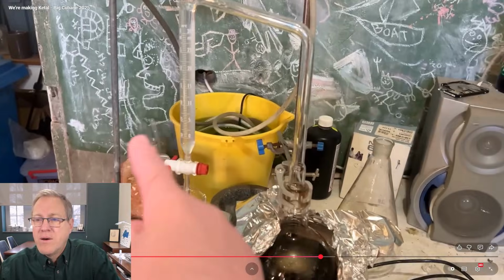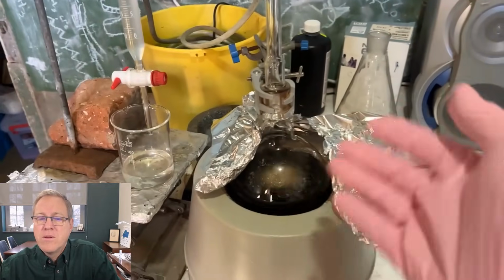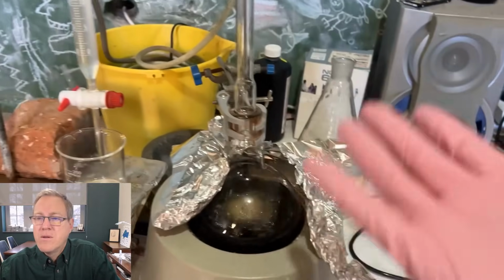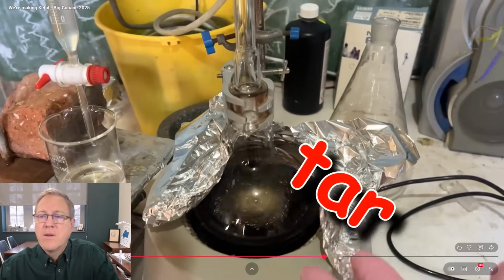Hours, 5 hours yesterday, 7 hours today. I didn't really run it overnight too much. In fact, I kind of left it standing overnight, which made it go black, I think. Well, it might have gone black anyway. I mean, play the clip. It's tarry. It's not a great sign, but maybe just what happens.